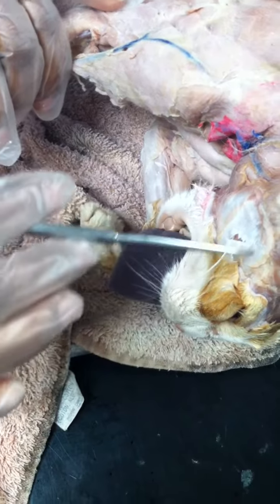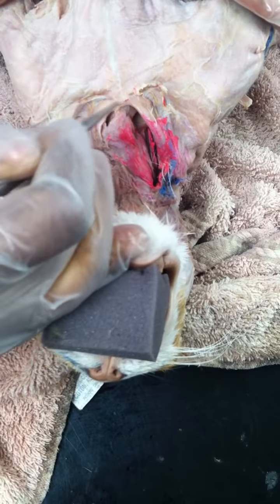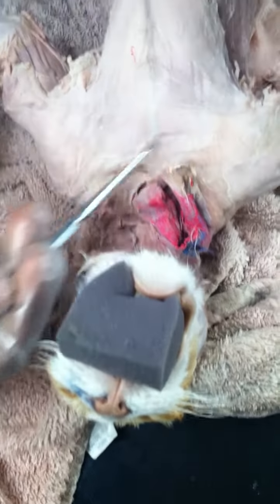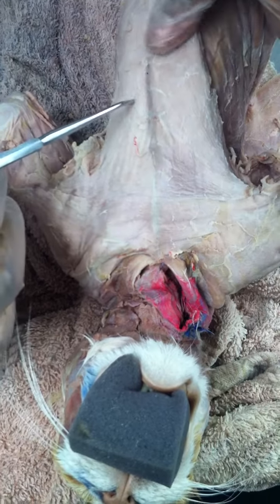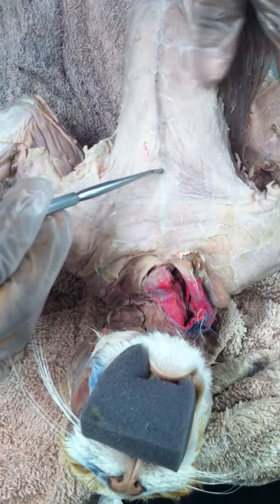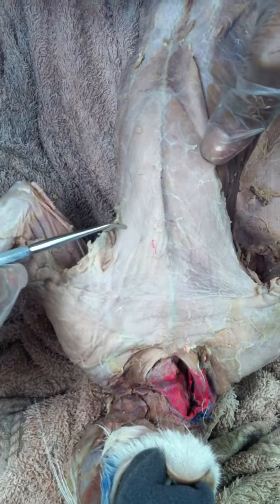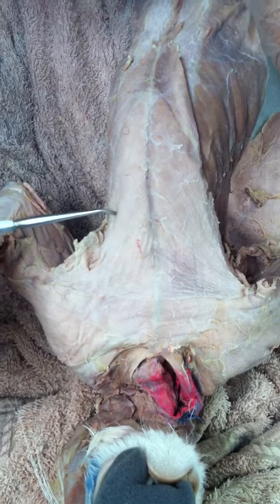Starting from the head, this is your masseter. These are your sternomastoid. Then down here, these you don't need to know. But you have a triangular muscle here. Here you can see that. That's pectoralis major. Underneath it, all this band of muscles. And here all this. So this muscle here, that's your pectoralis minor.